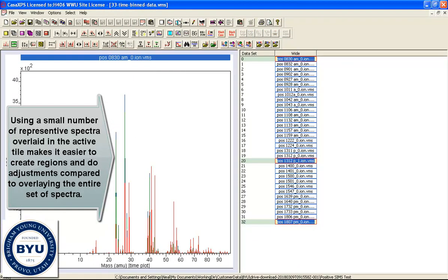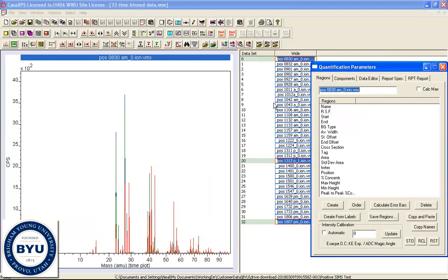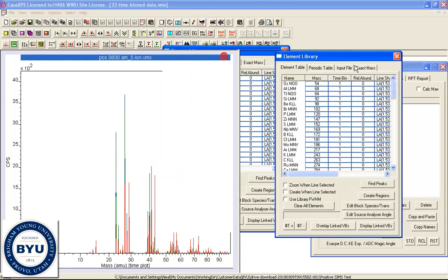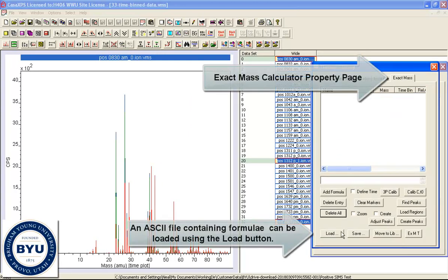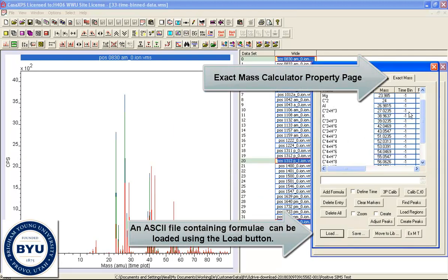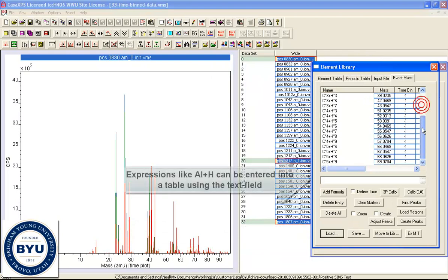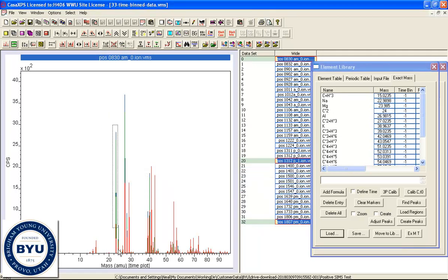So we'll do this by using regions, and the regions will be used to identify peaks, and these will associate a mass with a given time channel. We'll also use the exact mass calculator, and I've got in a file that I had prepared earlier, so I can load, and these include a range of different masses that I might use for my calibration. So the problem is to associate a peak with its mass and time bin.